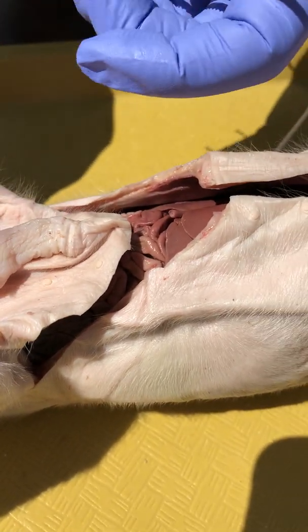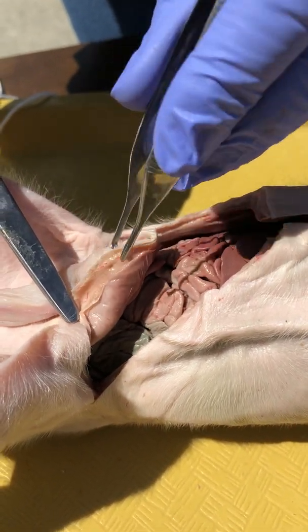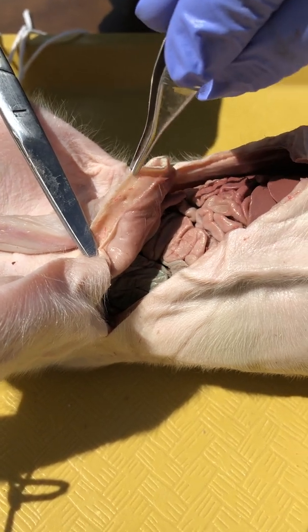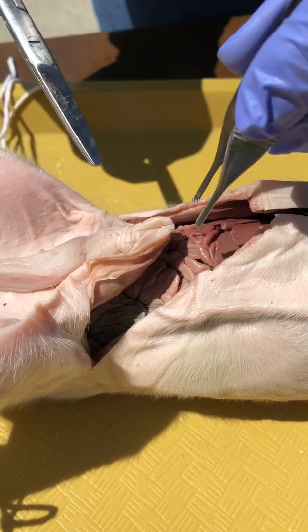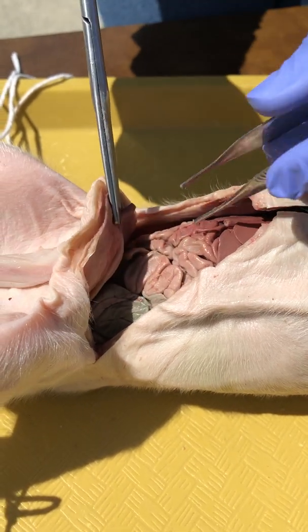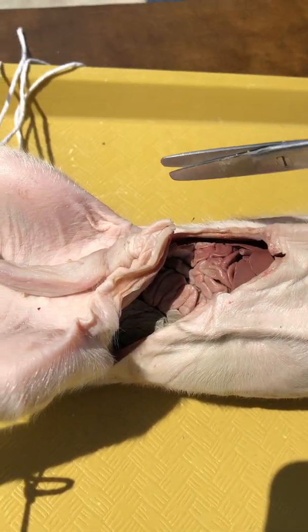Let me pick this up a little bit better here. You can see that it's skin with a muscle layer underneath, and then there's going to be this shiny lining in there. So: skin, then muscle, then shiny lining. Pinch that body wall, pick it up a little bit, and then just cut until you can see you're in a cavity, then stop cutting.